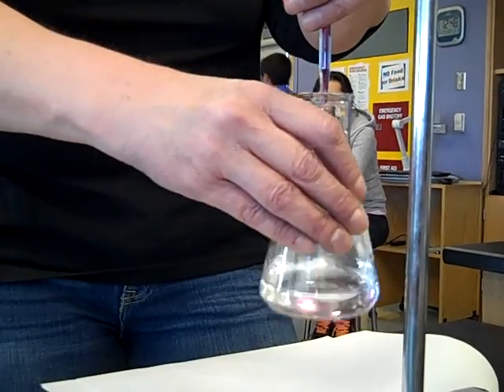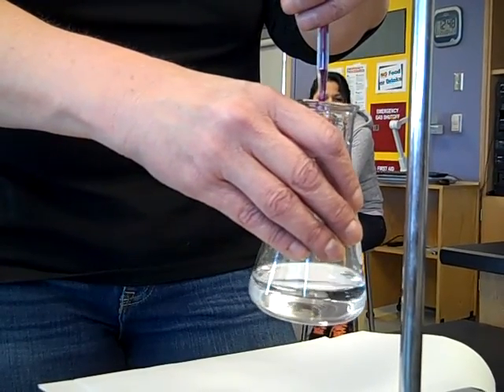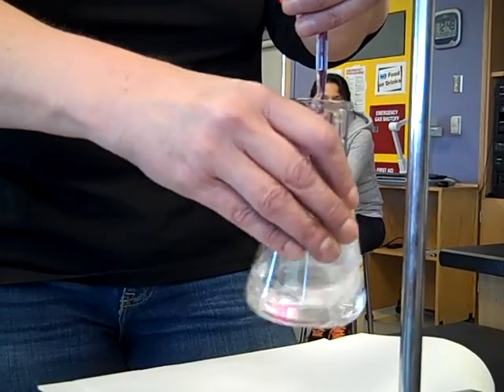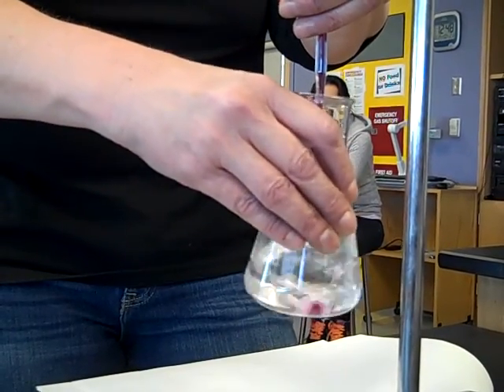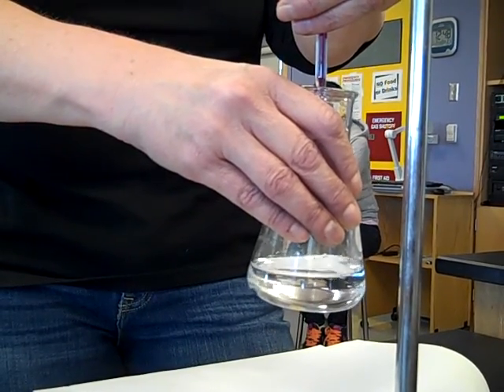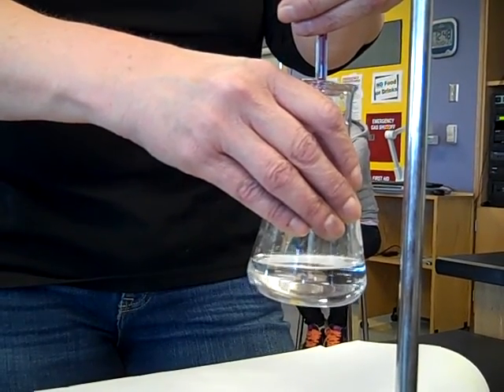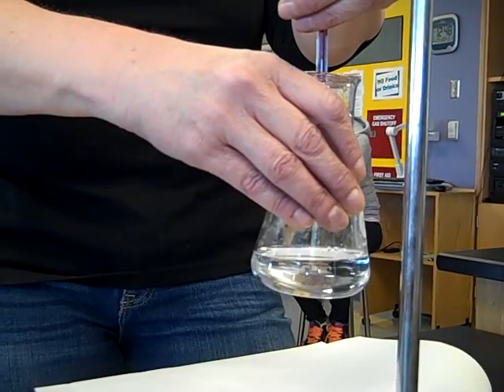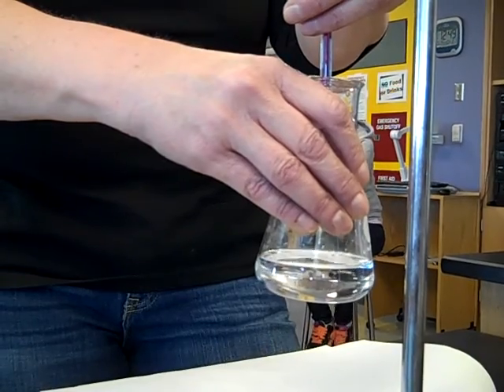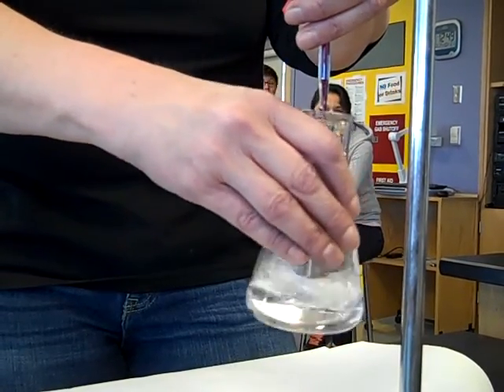This part is like watching grass grow. If you're impatient — which never helps in lab — this part goes very badly. If you hold up your Erlenmeyer flask with a hot pink solution, that's wrong. Should it be hot pink? No — pale pink. If you embrace your girl colors, it's going to turn out to be kind of rose.